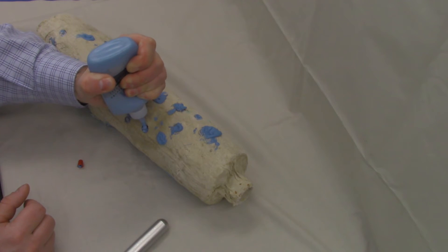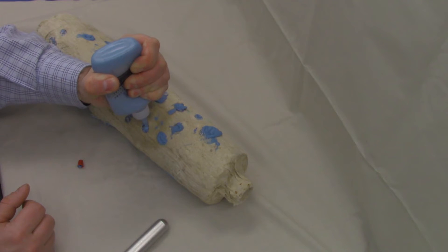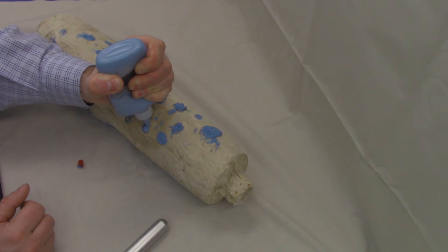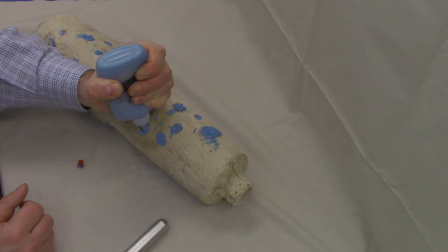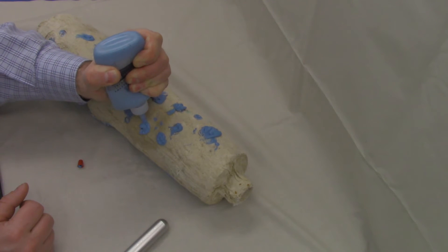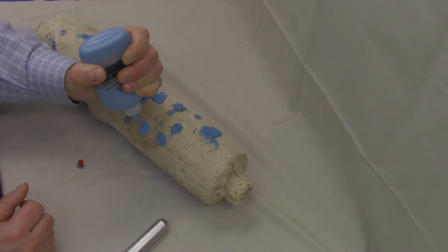And we're simply going to backfill that opening pretty substantially because it does contract while drying. And then for that reason, we overfill onto the top some and make sure we're past the opening.